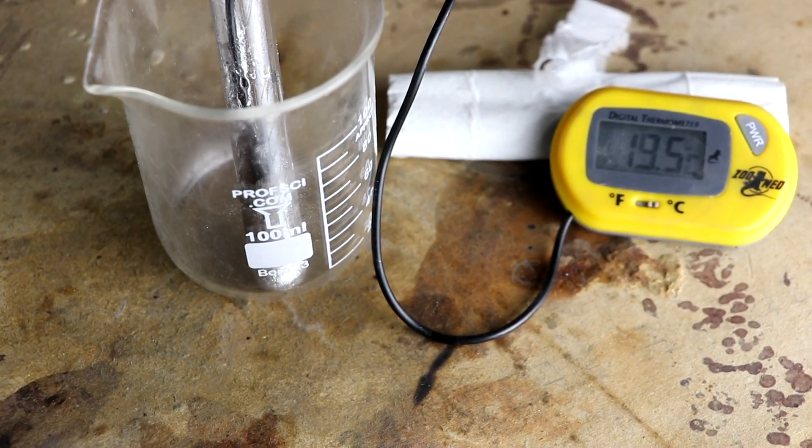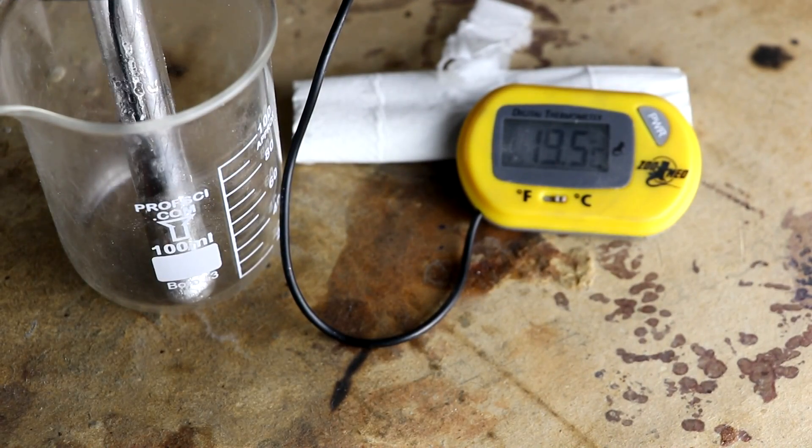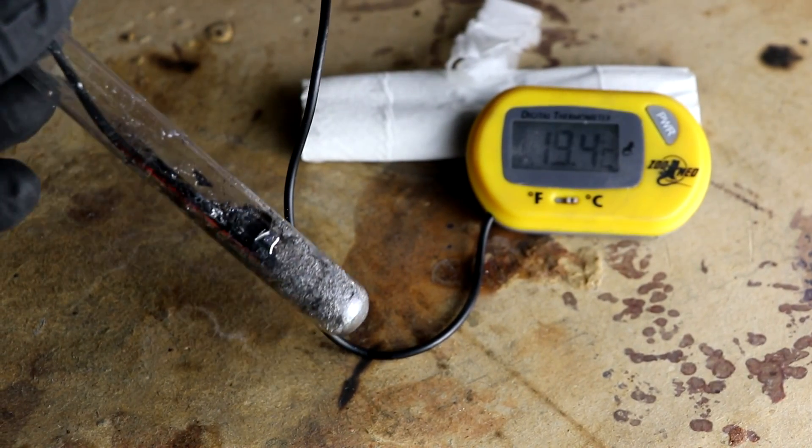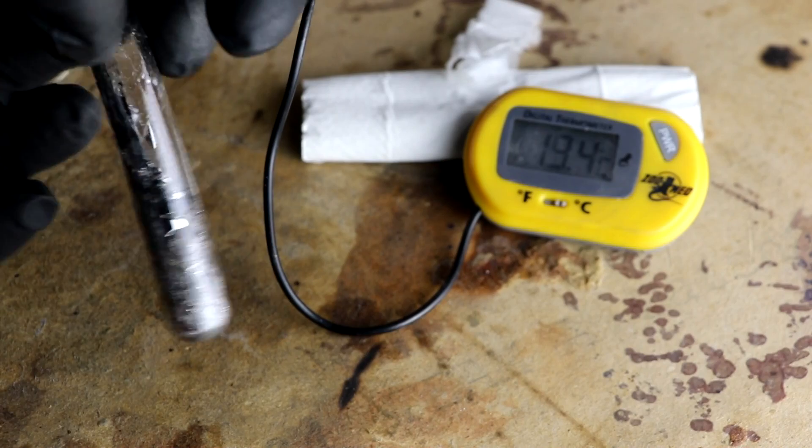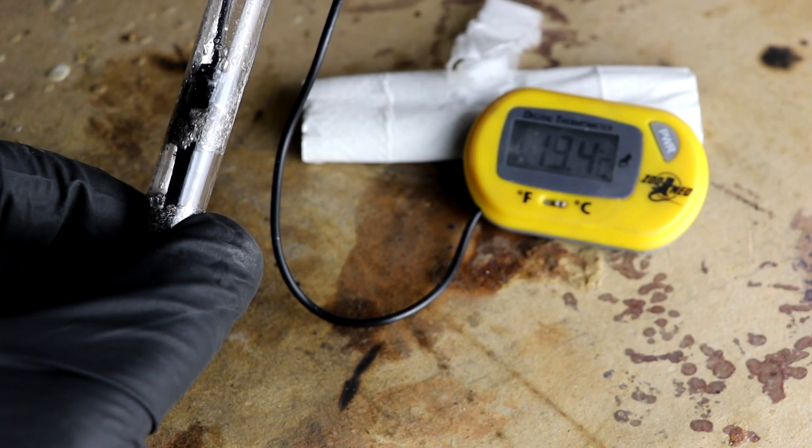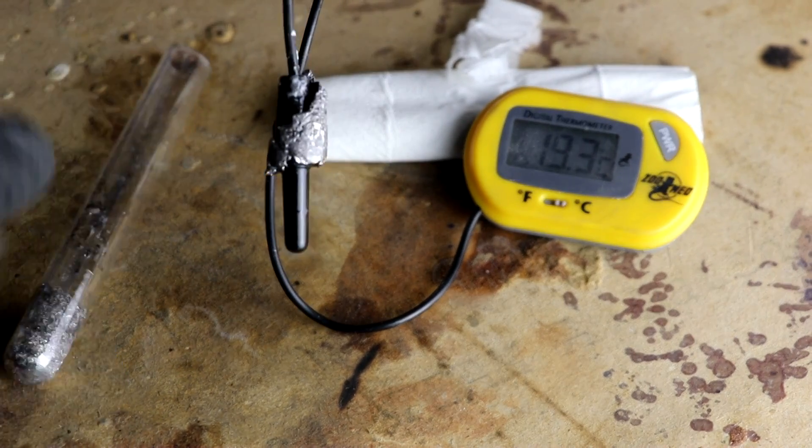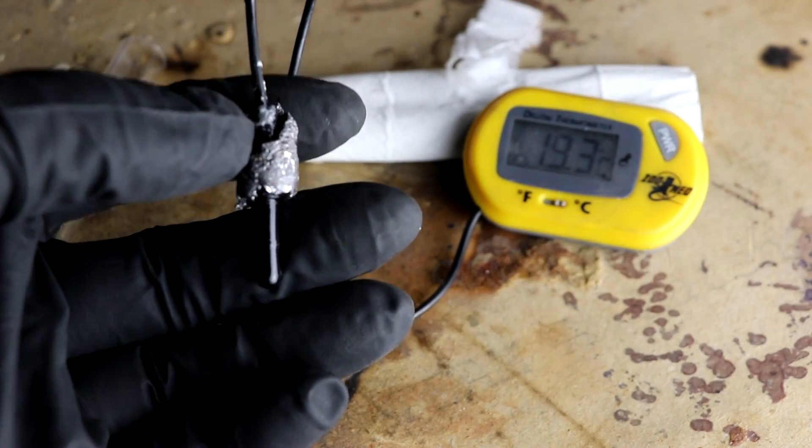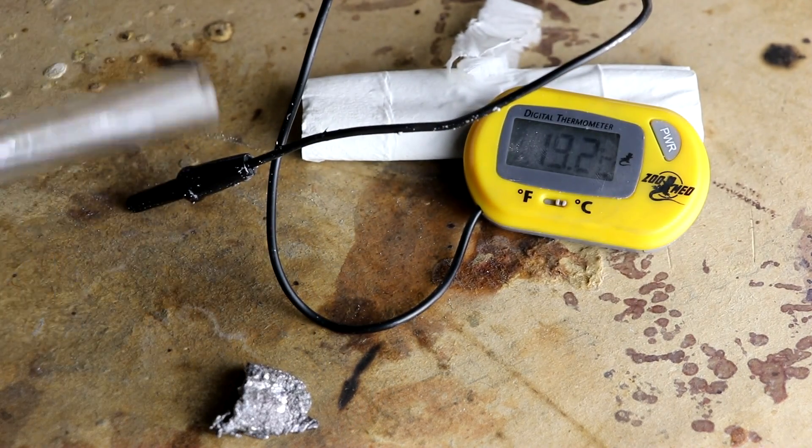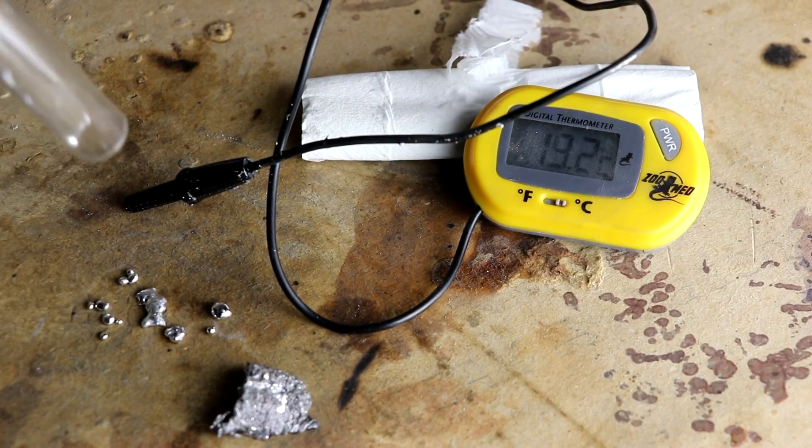So back to this camera. The temperature got over 10 degrees above the ambient temperature. That's kind of cool watching that happen. So the heat of solidification is definitely there. And actually it looks like the whole thing is solidified now. I mean it's not really solidified. I think there's still an excess of the gallium alloy. Yeah, you can see it's running out of the mixture.